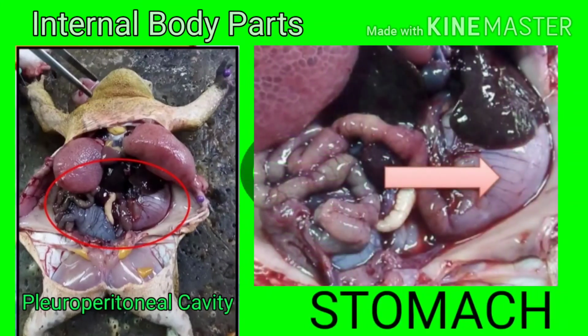Next is the stomach, a bag-shaped, muscular, slightly curved sac posterior to the esophagus which secretes substances that aid in chemical digestion and mechanically breaks down food. It has two regions: the cardiac region, which is a wider anterior portion which joins the esophagus with the stomach, and the pyloric region, which is the posterior region located near the pyloric sphincter.